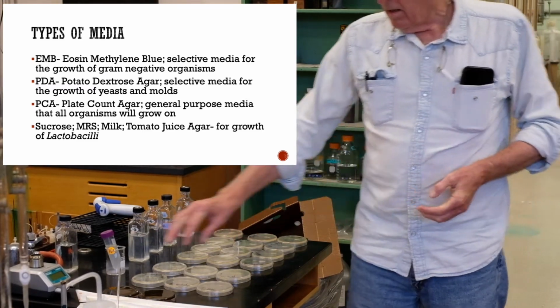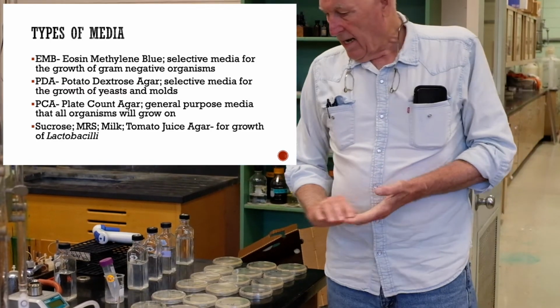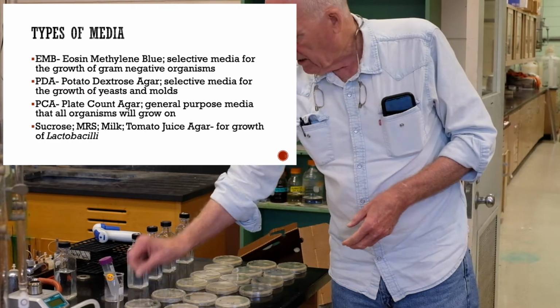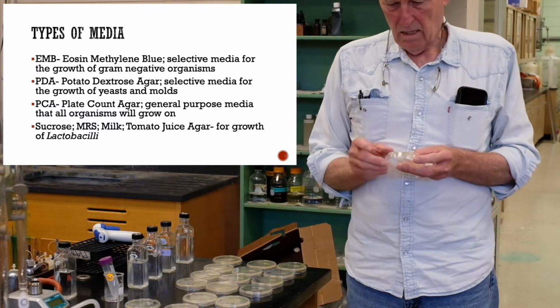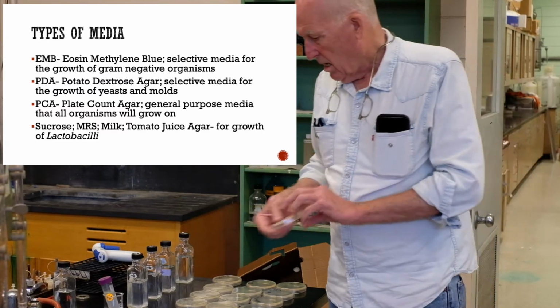We have the EMB for the gram negatives. You saw that from a previous video. I have potato dextrose to enumerate yeast and molds. We'll talk about yeast and molds later. I have plate count agar that enumerates everything, so we're going to have a total count on that.